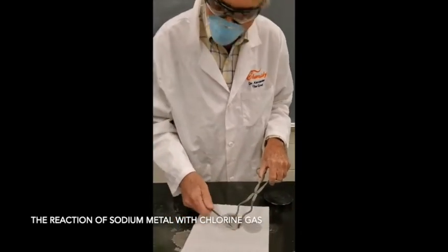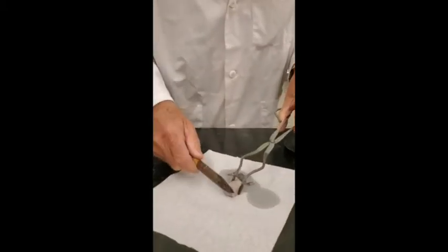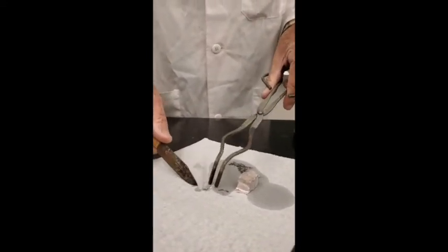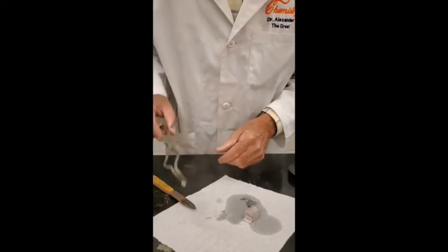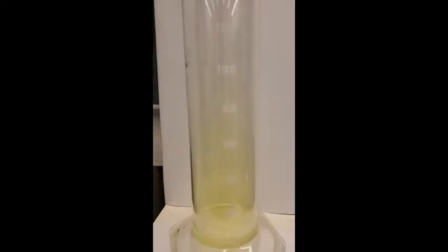Remember we looked at the very active metals? This is some more sodium. I'm going to put some sodium in there, and it's going to float around on the water. I'm just going to put a little bit in there. The sodium is going to be clean, and so the sodium should react with the chlorine to form the most famous compound of both sodium and chlorine, known as sodium chloride. I think that's going to be all right. Sometimes it reacts with the hydrogen too. We'll see. Ready? Looking at it.